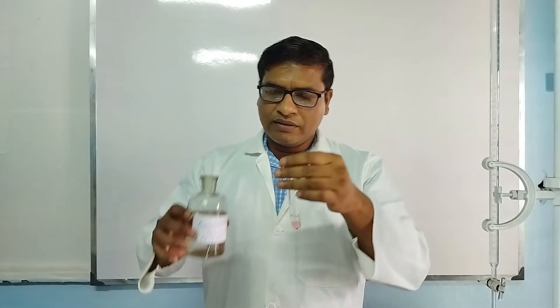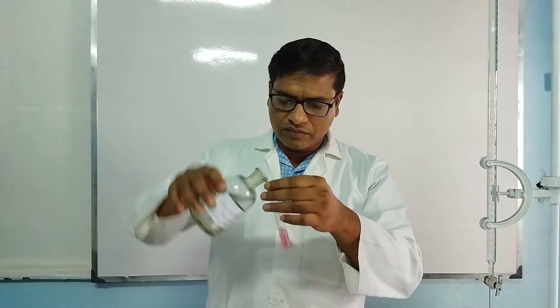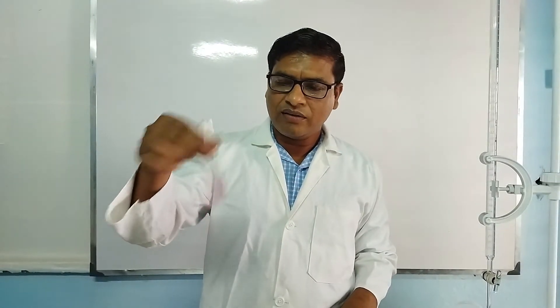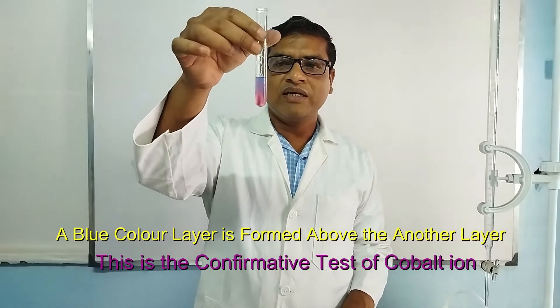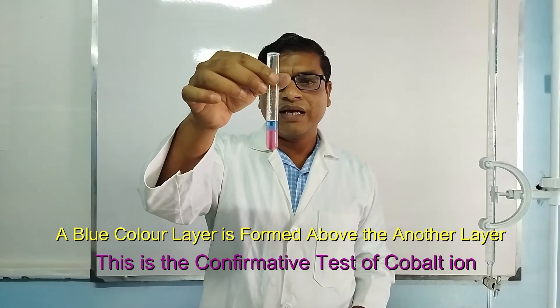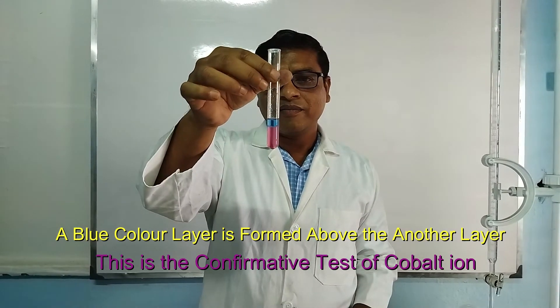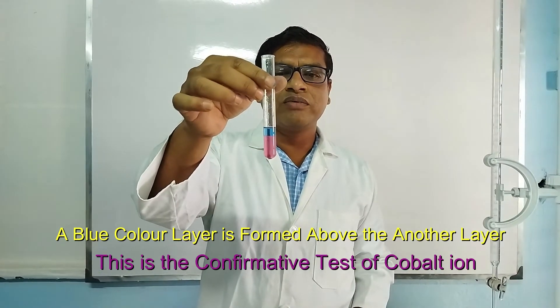Then we add a small amount of ammonium thiocyanate and shake it well. After some time, we see that again two layers are formed and a blue color layer is formed. This is the confirmative test of cobalt.